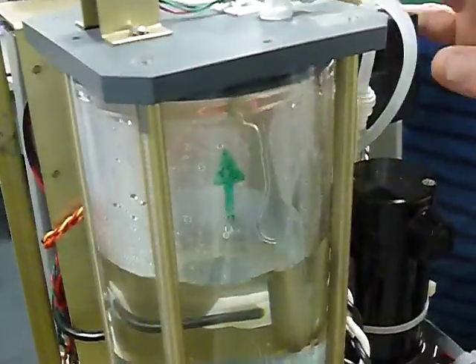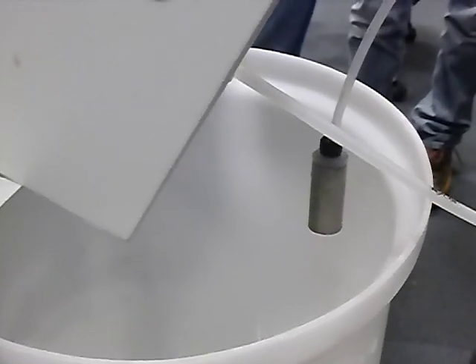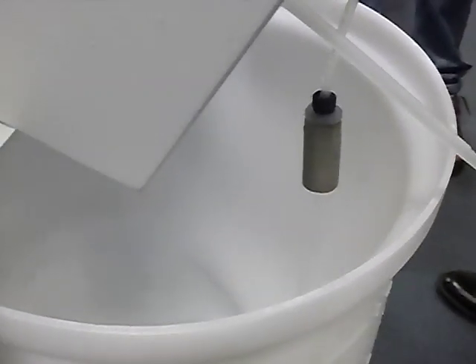So these two solenoids open. All right. Now this one opened up and let some pressure out. Now it's pushing up. We're taking in a lot extra. And that extra is going out here. That's why the filter's always going to get cleaned, coming in and out. So that filter now is going to have the excess come out. So it gets up to 500. Boom. It knows it's 500.